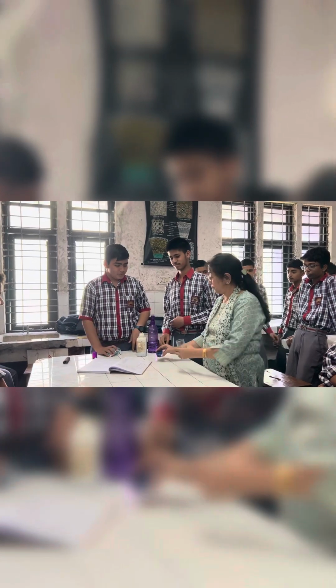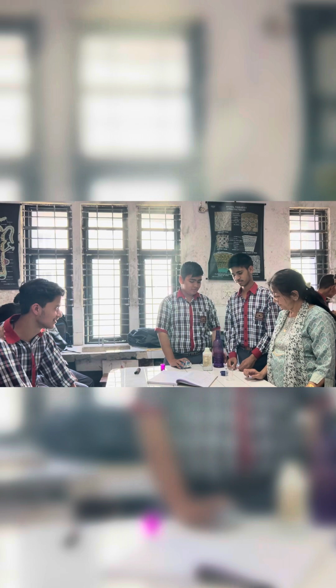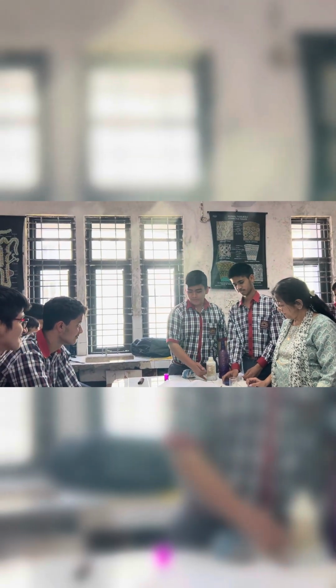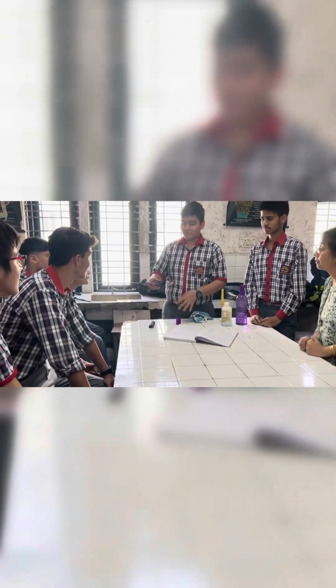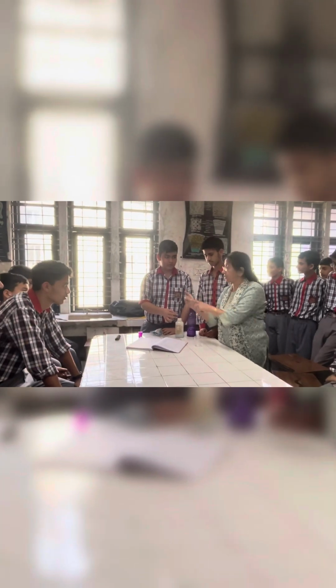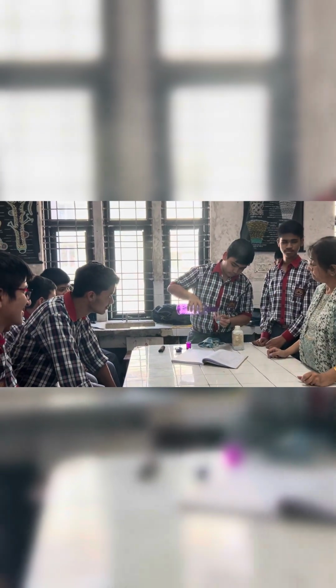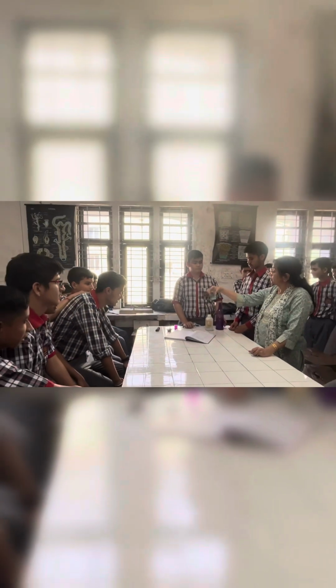You say it. So today we are going to do a displacement reaction. For this we have taken some water, a beaker, copper sulfate and an iron. What is the color of copper sulfate? Blue. Now we will make an aqueous solution of copper sulfate. So first we have to take a little copper sulfate in the beaker. Add it. One pinch, not more. That's enough. Now we are going to add some water to it. So we'll mix it.